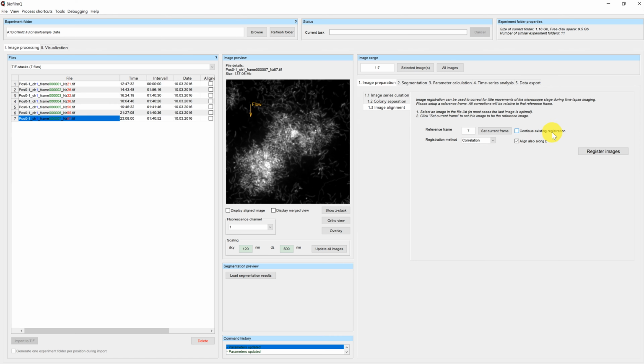Continue existing registration offers the possibility to register the first half of your time series in a quick go, and then continue if you want to proceed. In most cases, it is more efficient to register all images in one go. You can start the process by pressing the Register Images button.